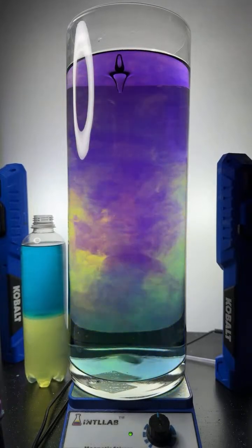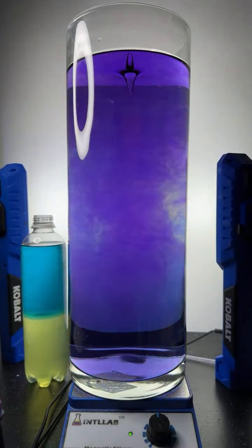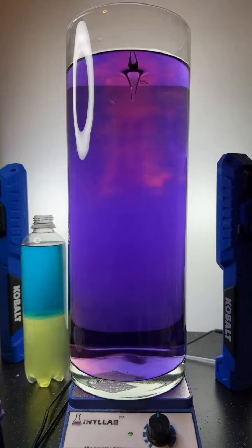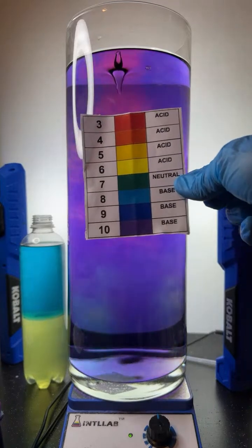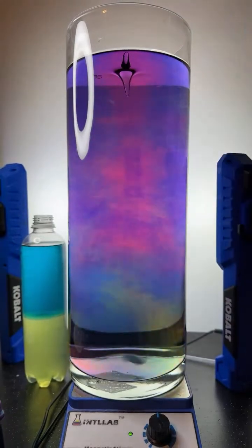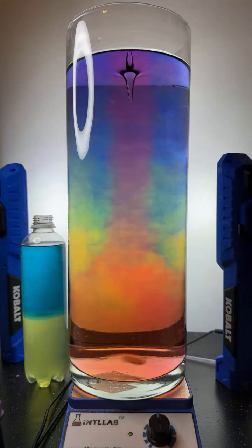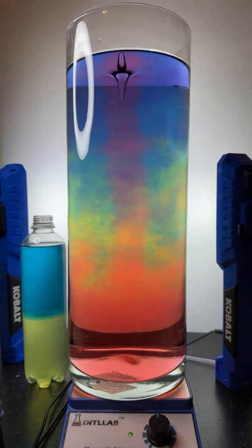All right, let's flip this around. Let's talk to you here for the end of the live. I want to acidify this first. I recover the chemicals that I'm using right here. So right now I'm acidifying the mixture, because I have found that if I acidify the mixture, lower its pH to around, at least pH 5, no mold grows in this, and I can just use it over and over and over again. So yeah, I often try to reuse the chemicals as much as possible.